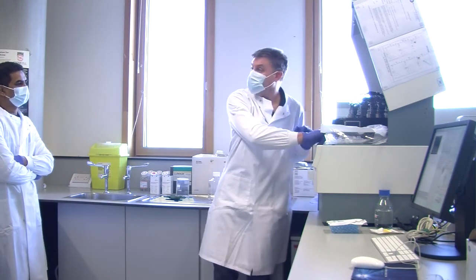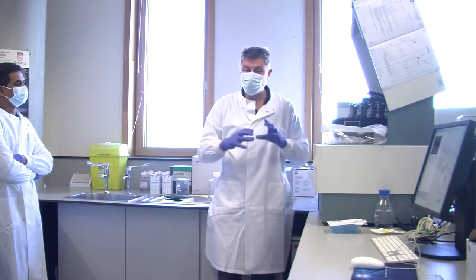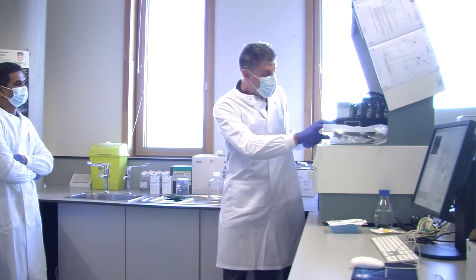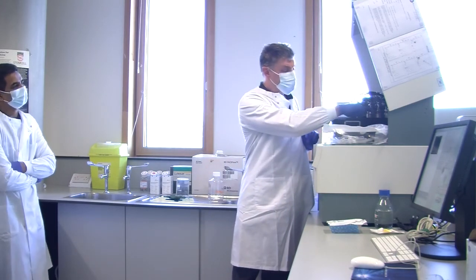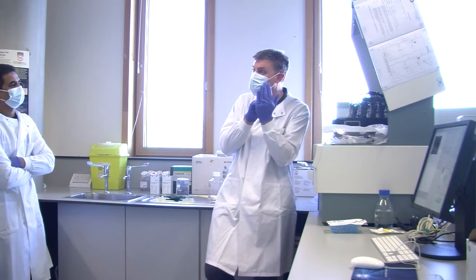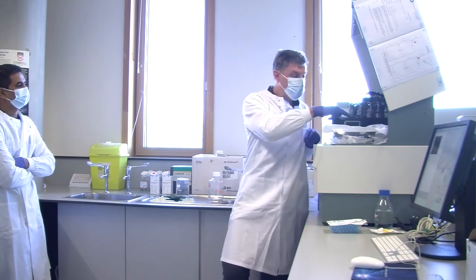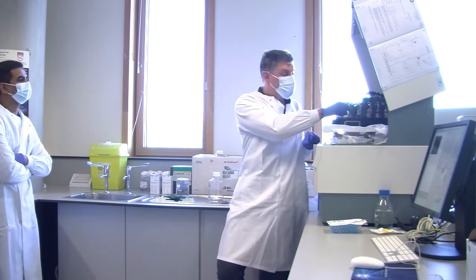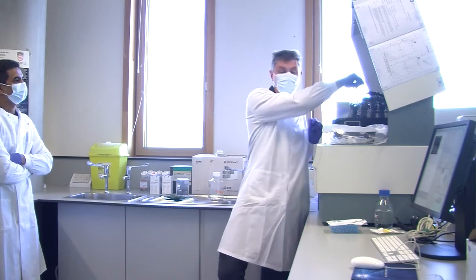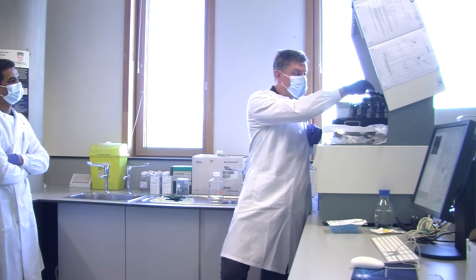Then the lasers come in and hit them. As the blue laser hits the cell, any fluorochromes excited by blue light start to glow. And what we have here are detectors. So we've got a green fluorochrome. Blue light hits the cell, and that green fluorochrome starts to give off green light. The green light goes through a whole load of different filters here, multiple filters, and is picked up by a green detector. It says there is that much green light, and that goes down the wires of the electronics. Orange light is picked up by another one, red light by another one, and far red light by another one.